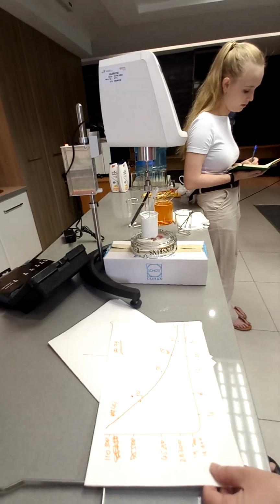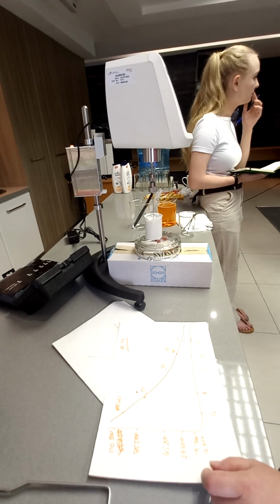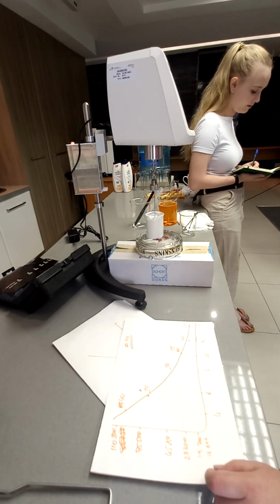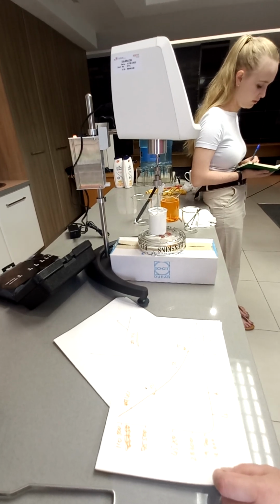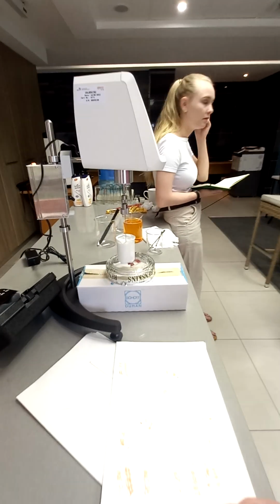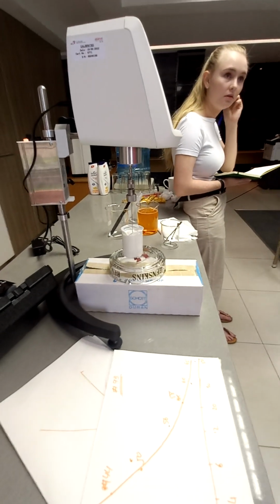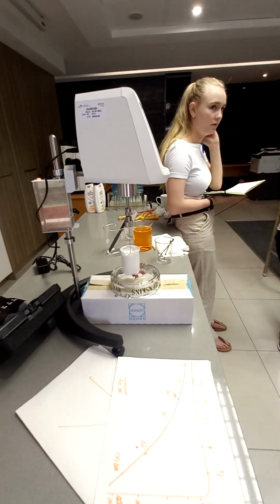Because the top RPM is too slow, I'll aim for 12. And then you aim maybe for change the spindles, it'll depend on your torque. So I would choose 12 as my speed and change spindles to see where I can get a torque closest to 50.